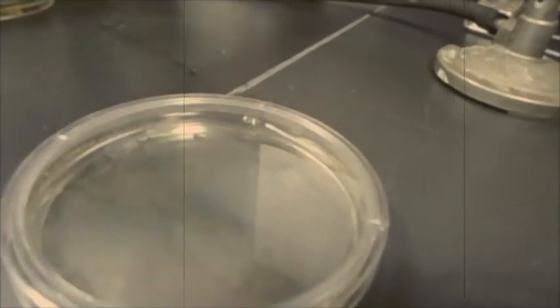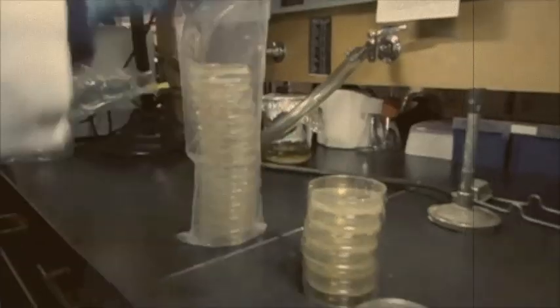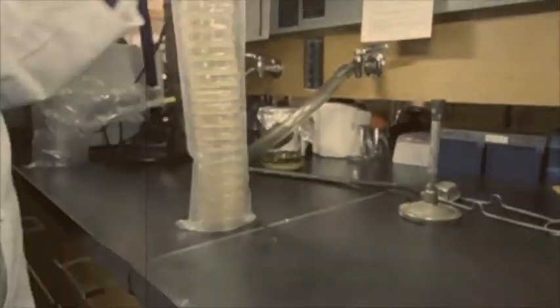When you are done, let plates sit overnight to solidify. Now they can be stored in the cold room for future use.